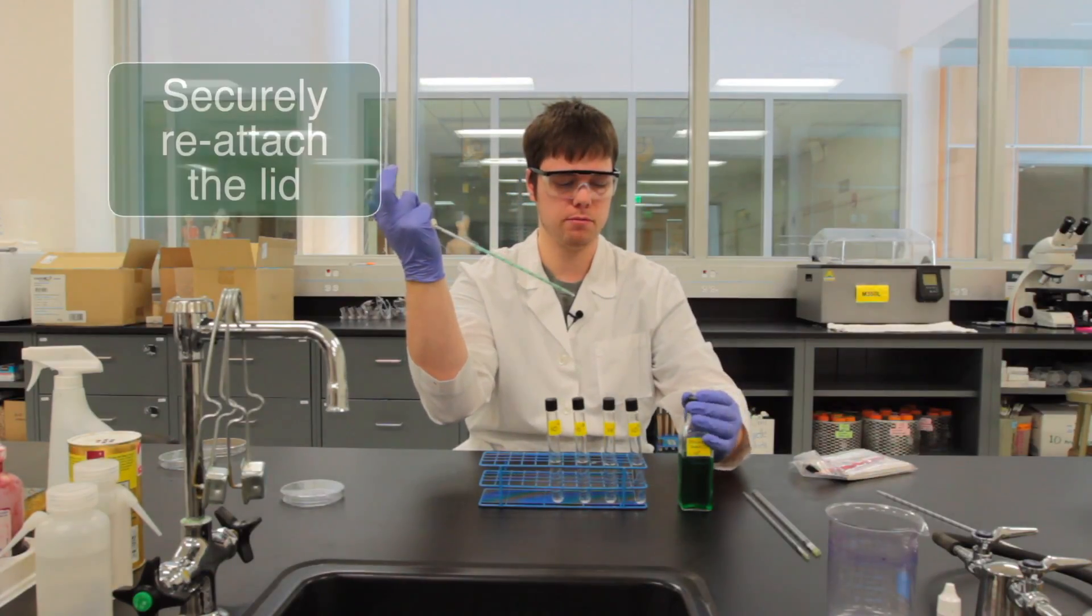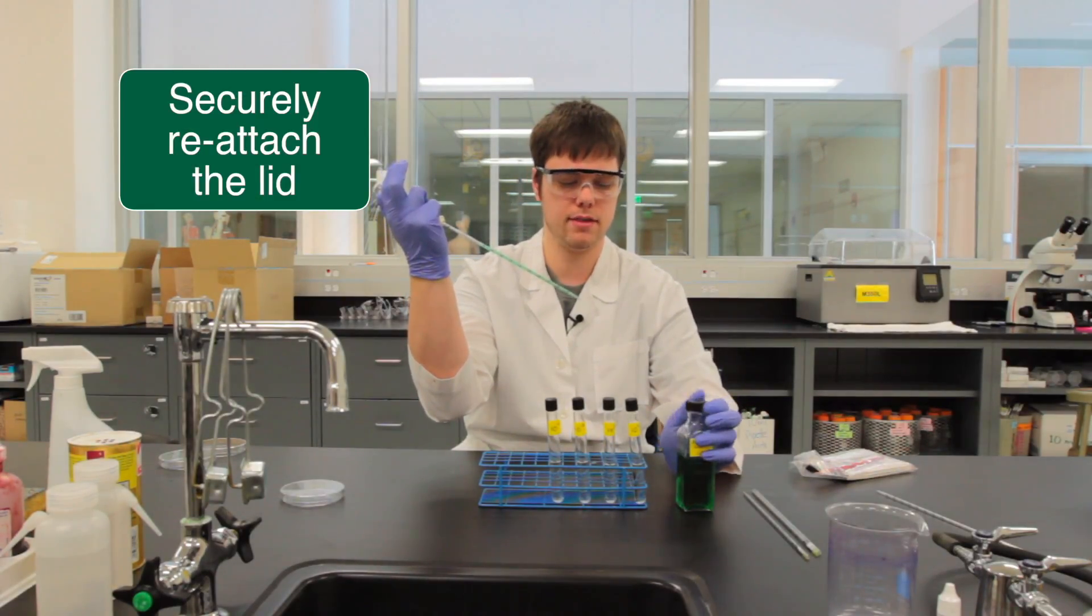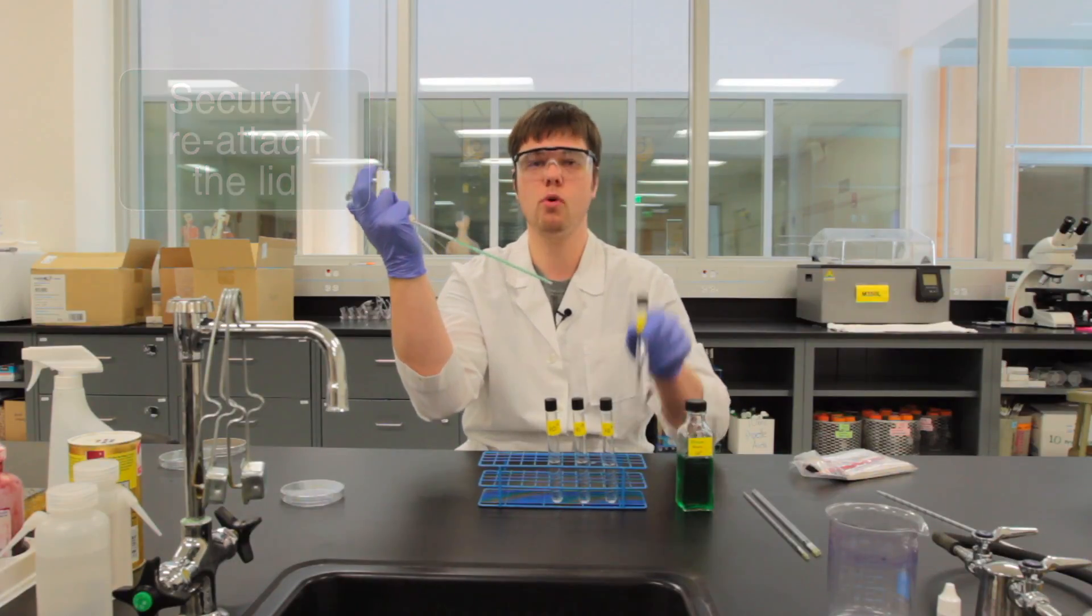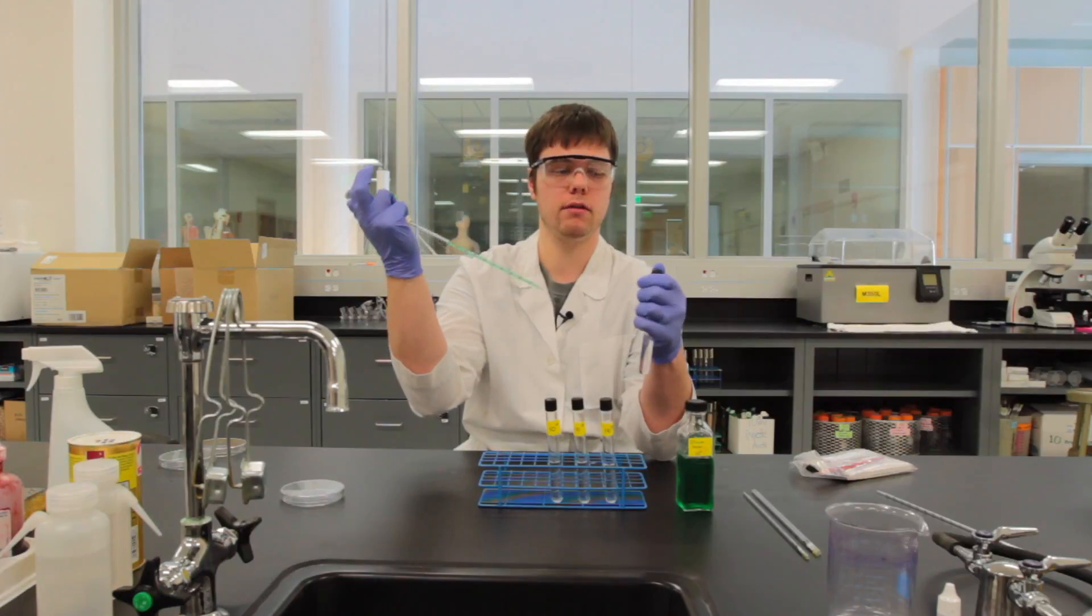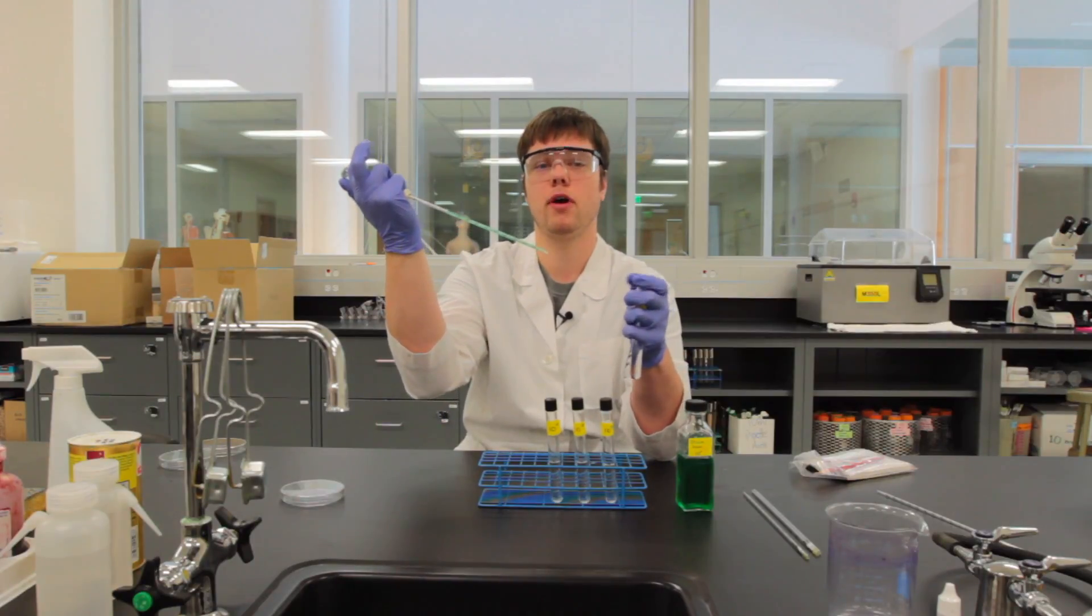We'll cap that up, make sure nothing falls in, being as aseptic as possible. Then we'll open up our ten to the negative one dilution vial, or whatever vial is present in your lab manual.